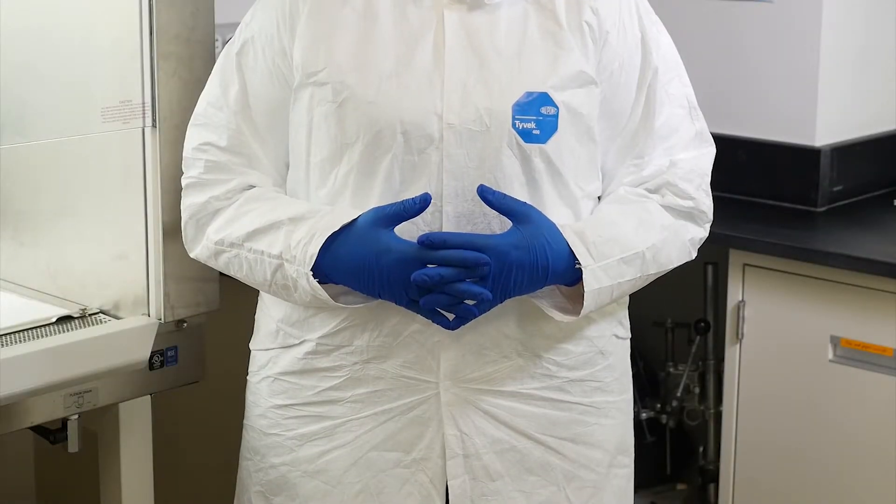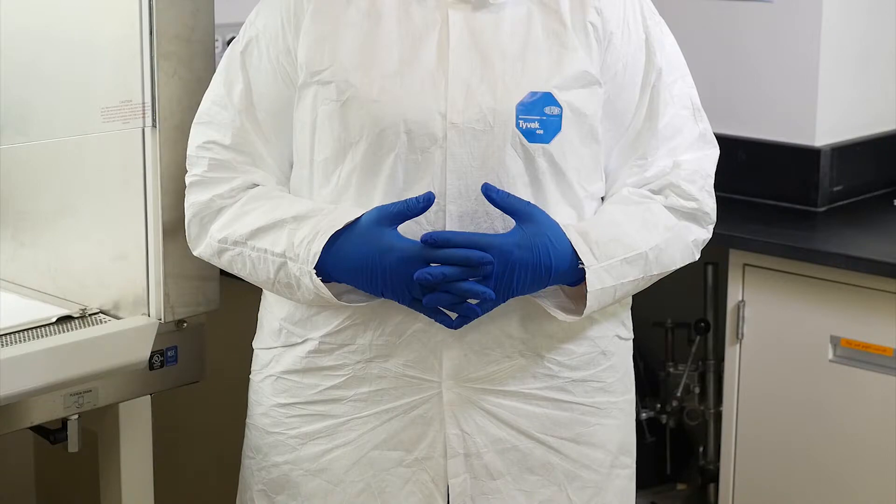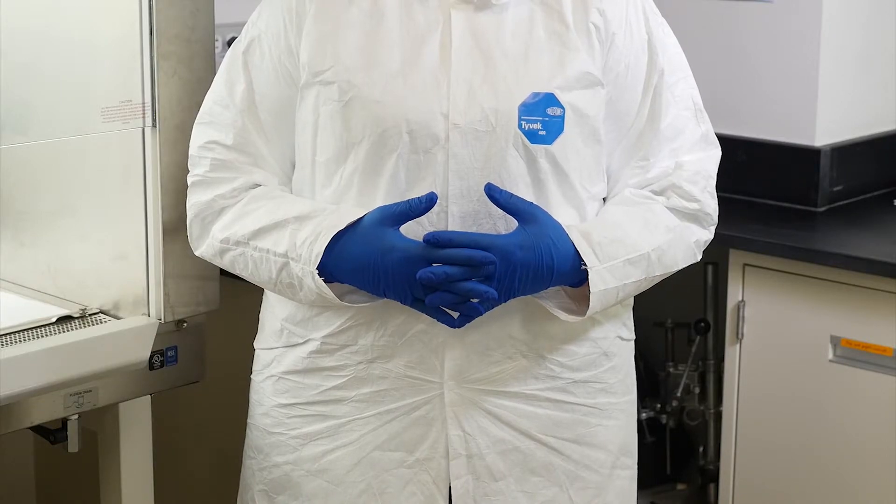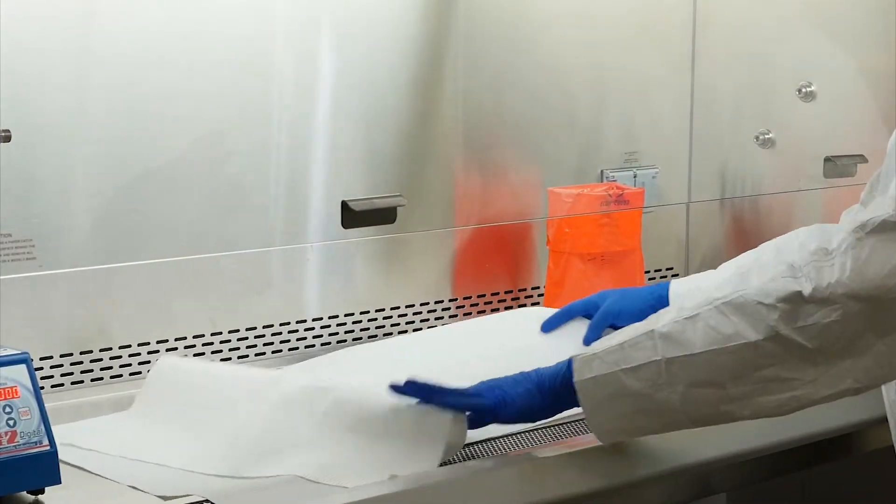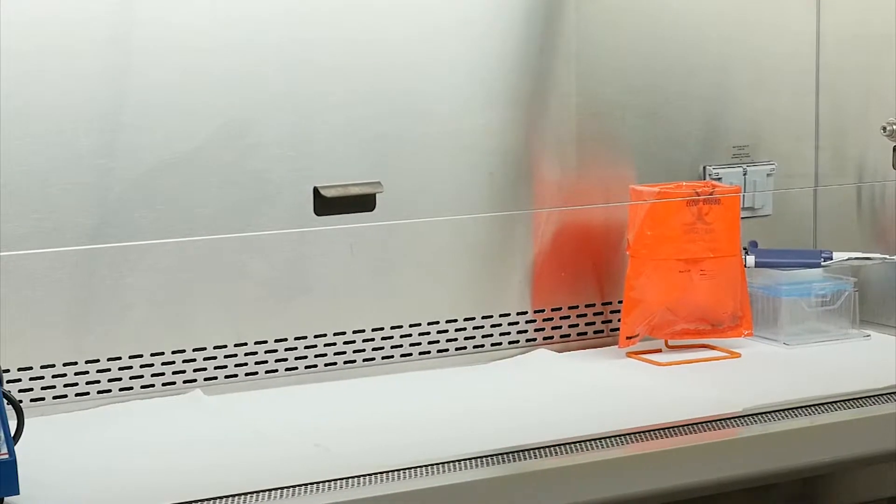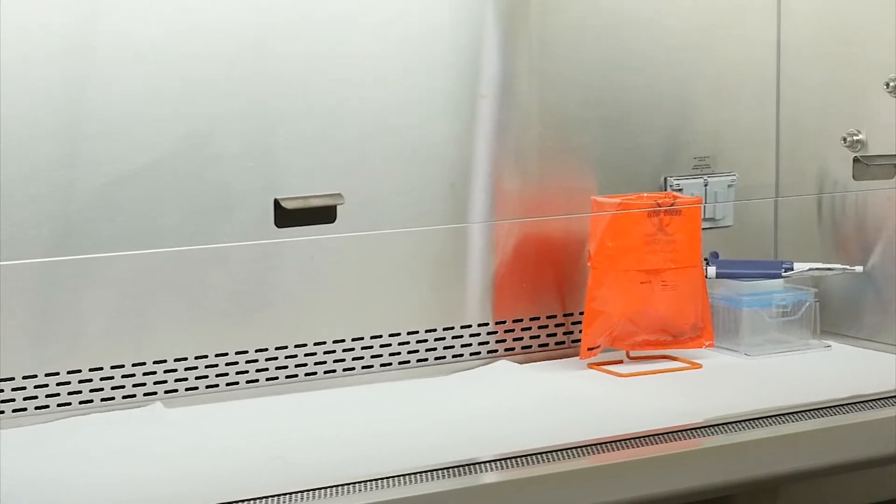As always, don your personal protective equipment including a lab coat and gloves. Disinfect the biosafety cabinet using your lab's approved methods such as Oxivir or Vircon followed by UV. Line the biosafety cabinet with bench paper in case of any spills. Add the following items to your biosafety cabinet.